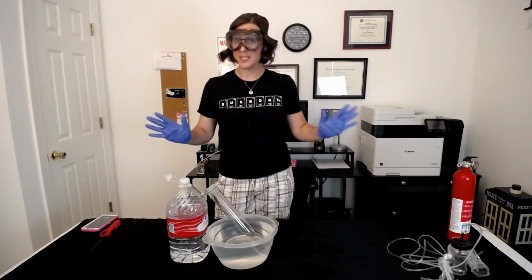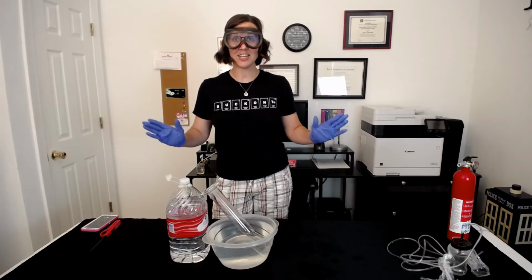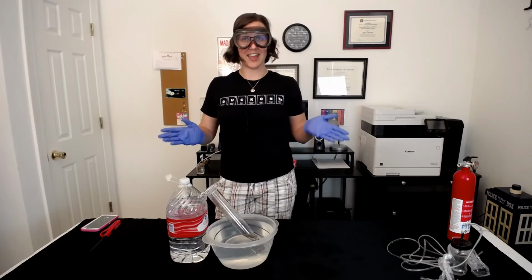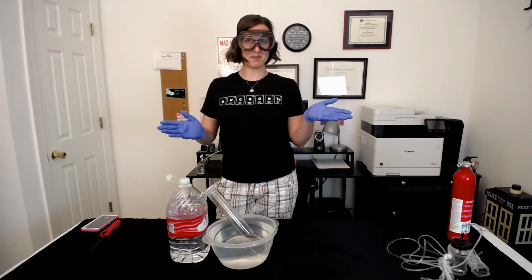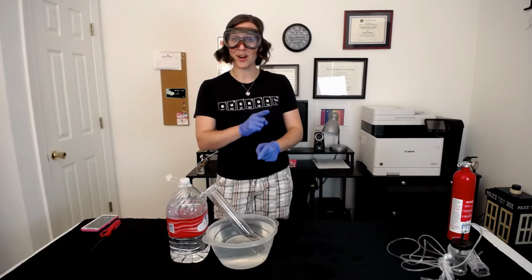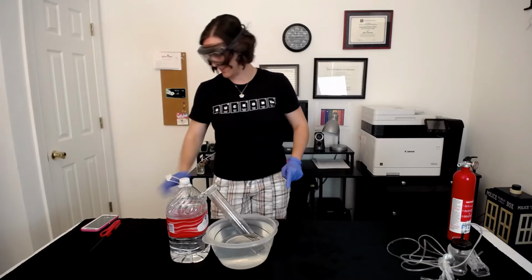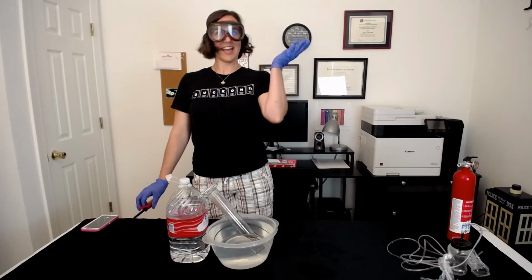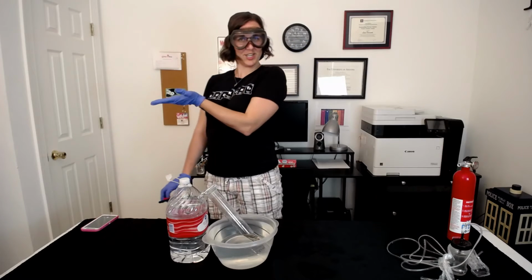Now, of course, the best part of this reaction is lighting the hydrogen gas on fire. But in order to do so, I'm going to need an extra pair of hands. So I've called over my very handsome hubby to help me lift this graduated cylinder out of the water without losing any of the hydrogen gas in order to light it on fire. Please welcome to the stage my wonderful, handsome, amazing husband, Jesse.